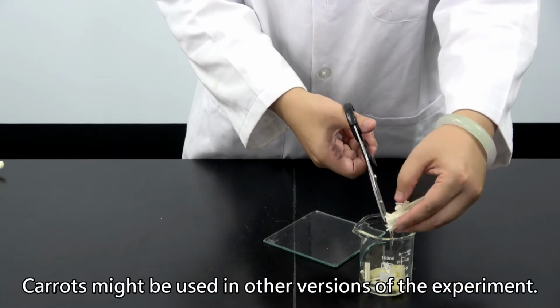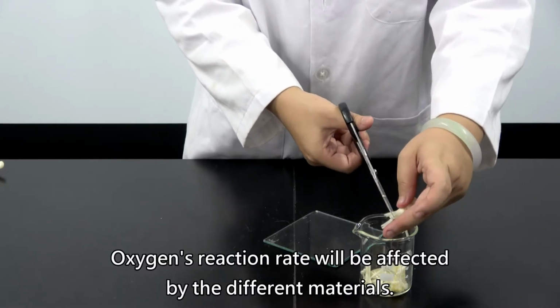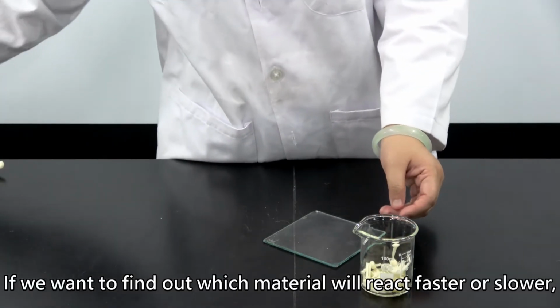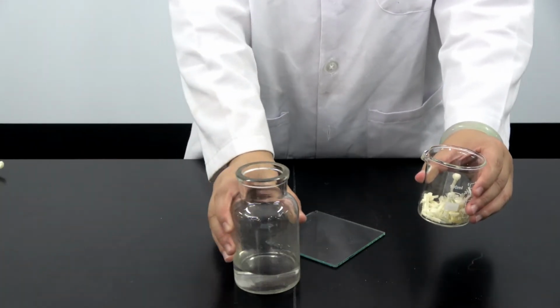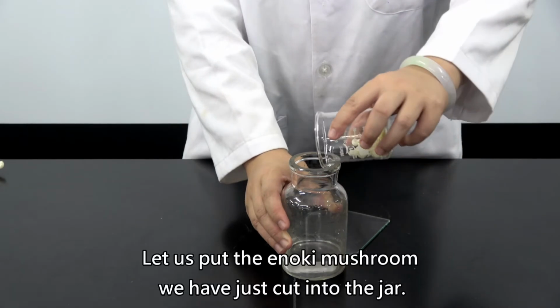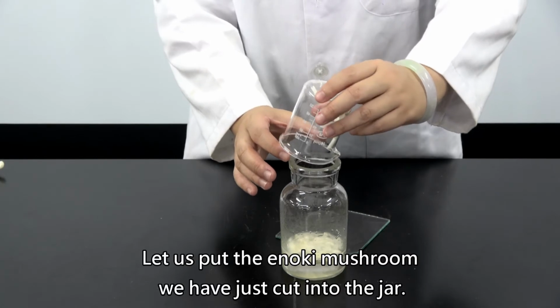Carrots might be used in other versions of the experiment. Oxygen's reaction rate will be affected by the different materials. If you want to find out which material will react faster or slower, we may use different materials as the reactant. Let us put the enoki mushroom we have just cut into the jar.